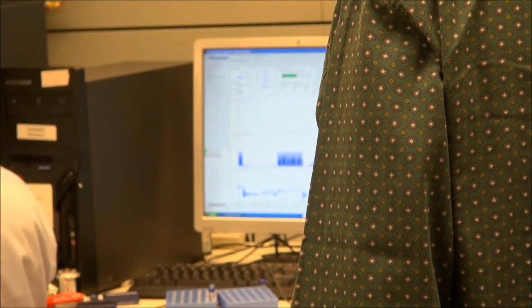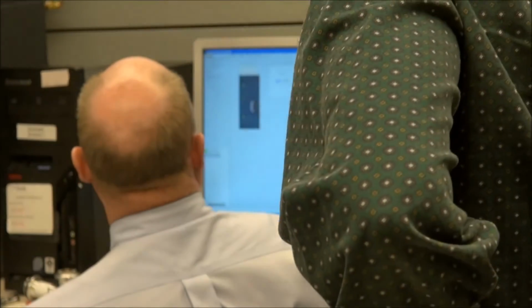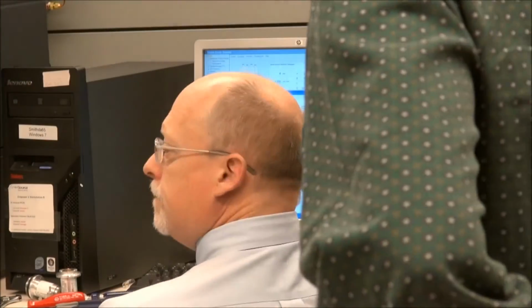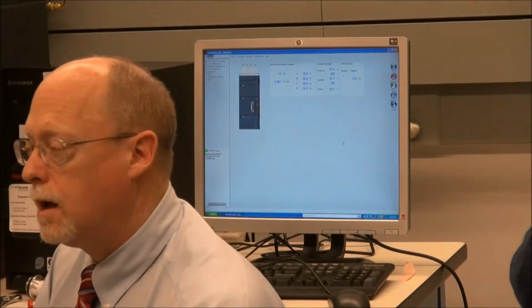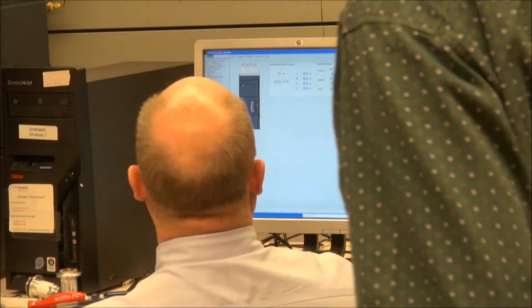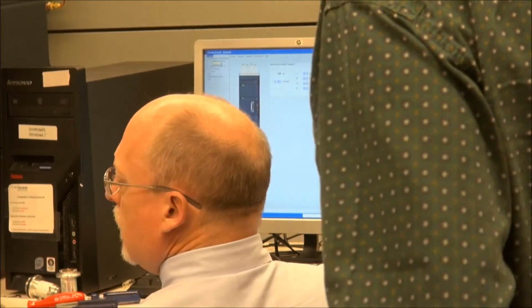So is there a leak detector? Every place where you see one of these, you have a place where you can put a leak detector in. At the top level, at the system top level control, see leak sensors? Okay. I can enable and disable all my leak sensors from here. I think we had a visitor. Who's that? That's convenient. So now, turn it on and off.